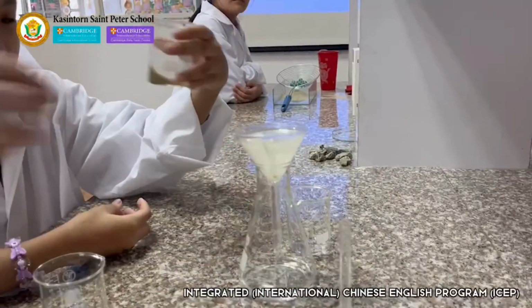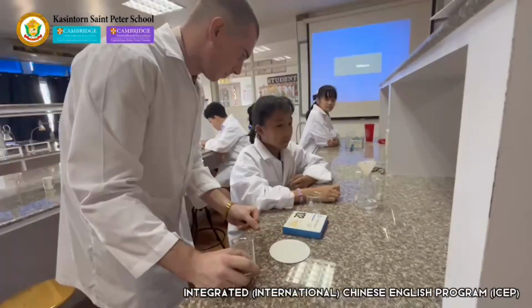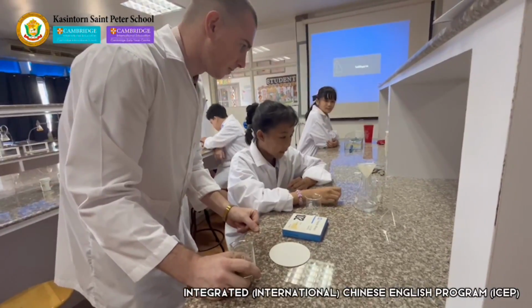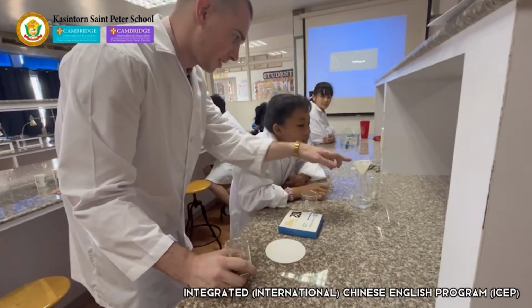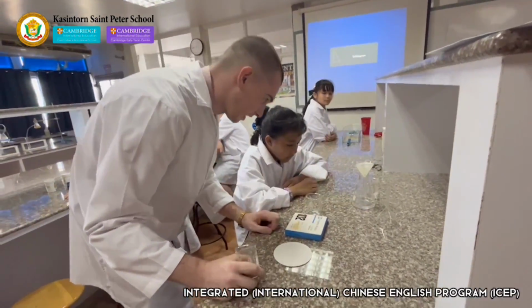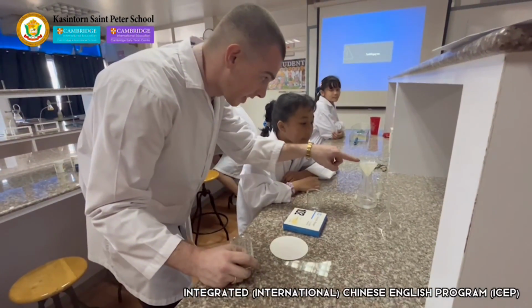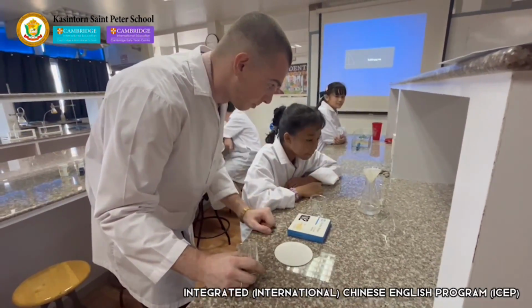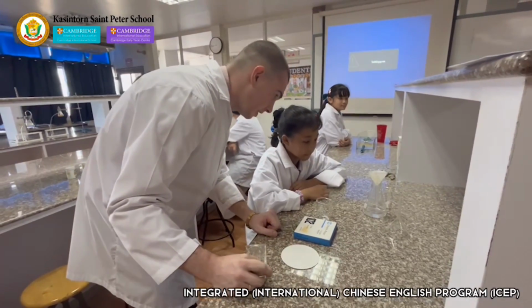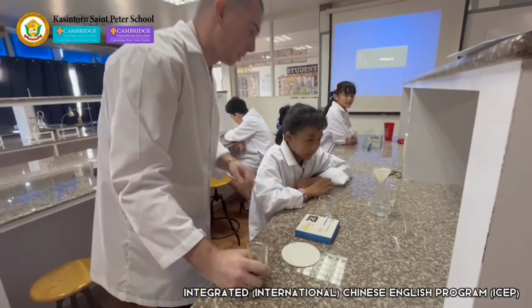So what can we see happening here? I can take that. The water passes through the paper and the sand stays behind. Yeah, we can see in the filter paper on top that the water is filtering through nice and clean. You can see there's clean water on the bottom and all the dirt and sand is left up here in the filter paper. Seems like a really easy way to separate a solid from a liquid if we need to. Thank you, Ping Ping.